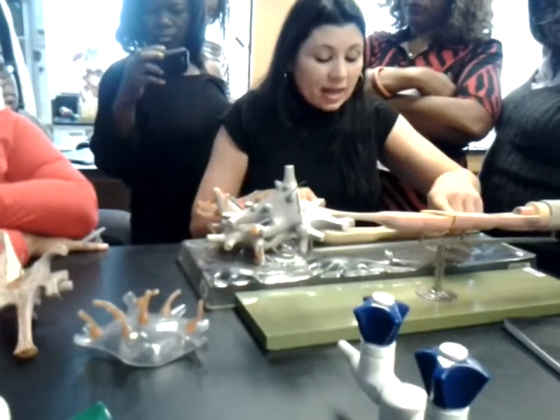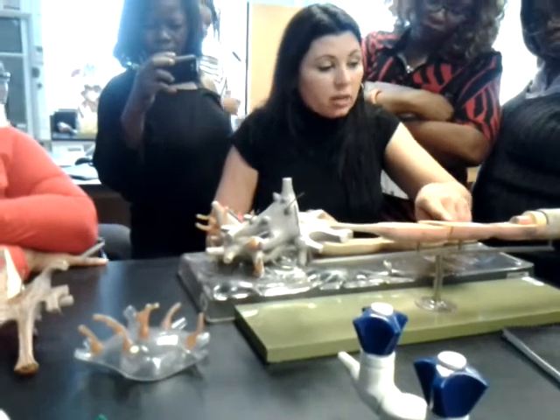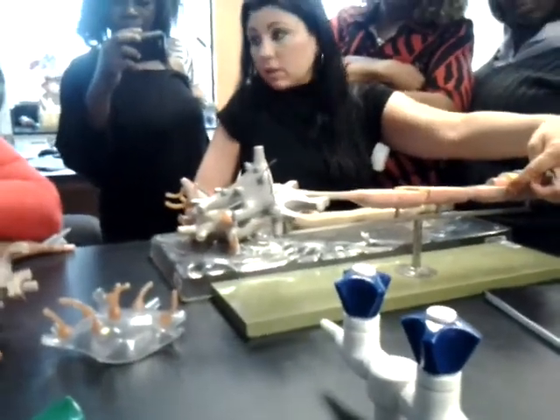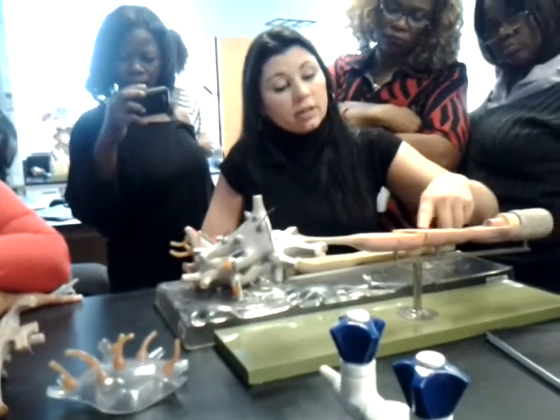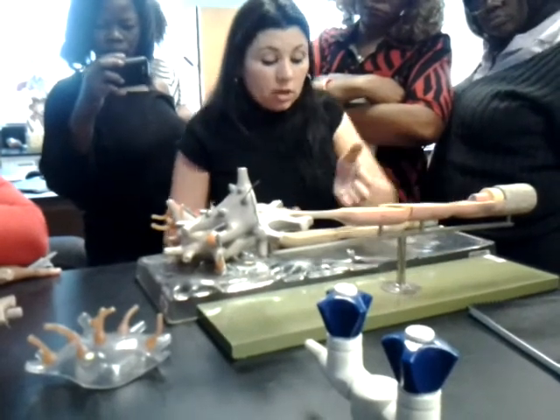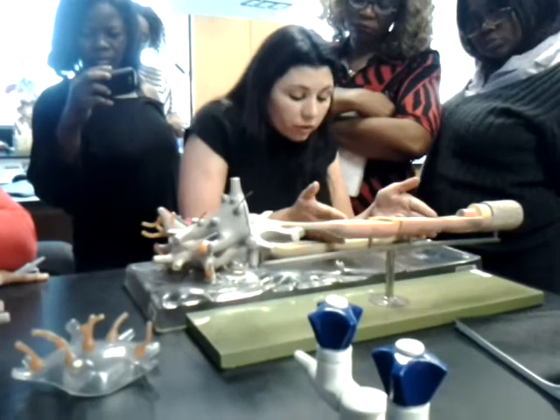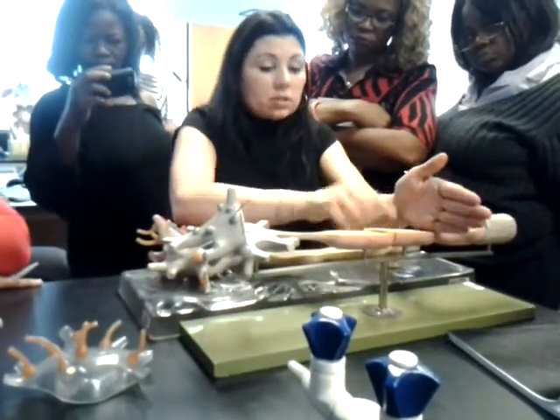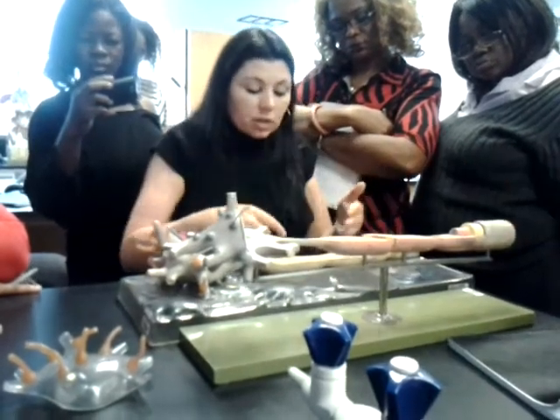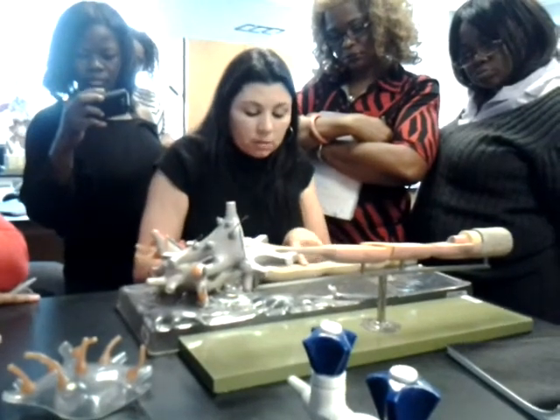If you look at each segment of myelin sheath, you will see this red projection sticking up, red bump, kind of embedded in the outer myelin sheath layer. That is actually the nucleus of the Schwann cell. So this whole area is a Schwann cell. This is another Schwann cell. They each have their own nucleus. One Schwann cell and then another Schwann cell. So they make and keep wrapping around to produce the myelin sheath.